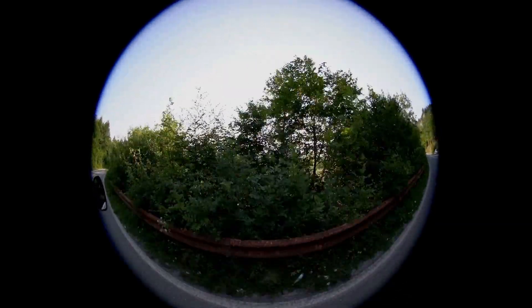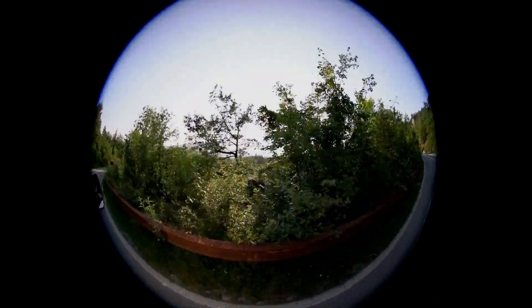There's a shame with the actual lens — this little tiny lens used for focusing a laser beam in a laser pointer. The issue with that is you get a nasty fisheye type effect. So you never really get a completely flat image filling the whole of your field of view like you would in a normal microscope.